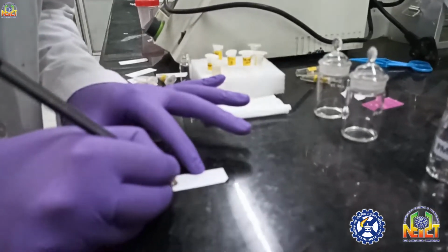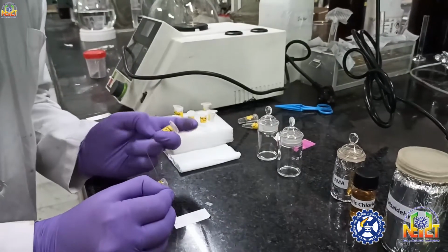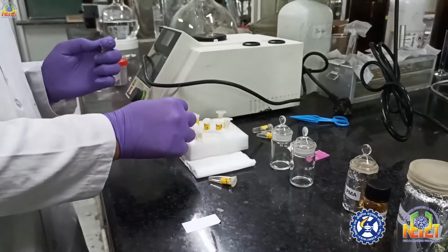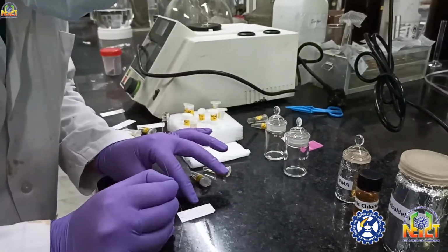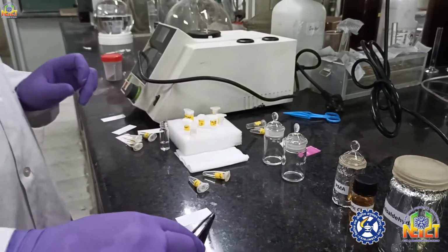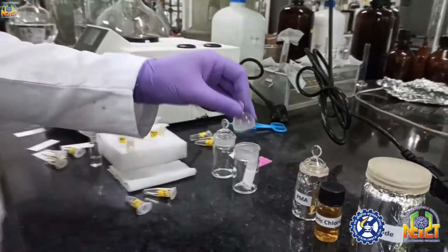Now I am showing you another stain. For that I am spotting the desired compounds, as these stains are specific for certain kinds of organic compounds. Some, like alcohols and unsaturated compounds, are visible in KMnO4, and amino acids and primary and secondary amines are visible in ninhydrin. So all the time I am spotting different compounds for certain or specific types of stains. I am keeping this TLC in the TLC chamber.